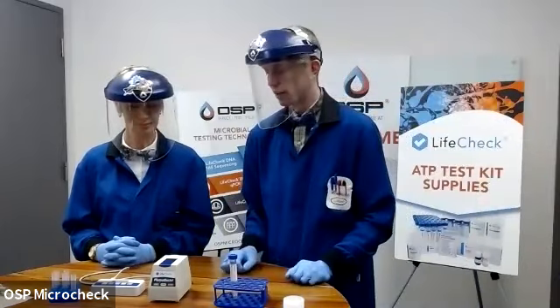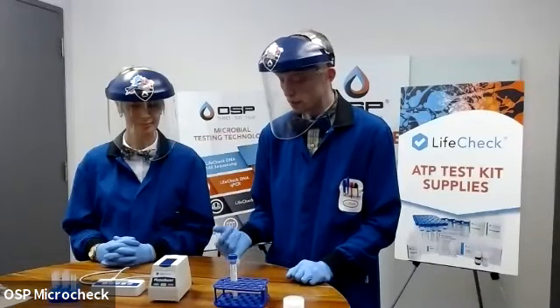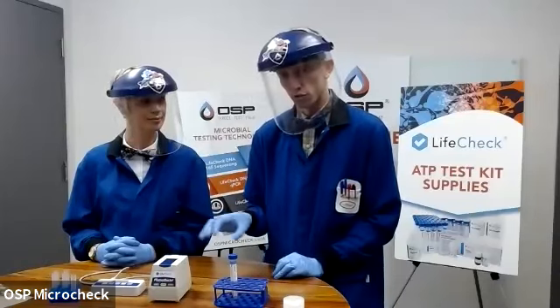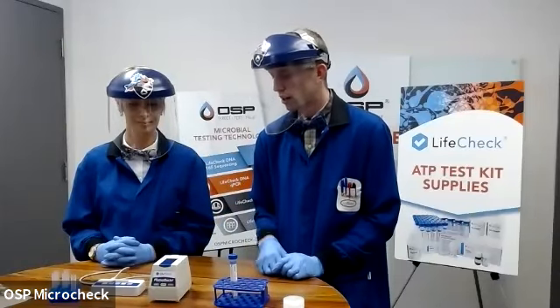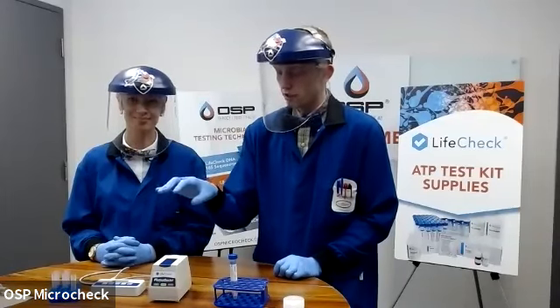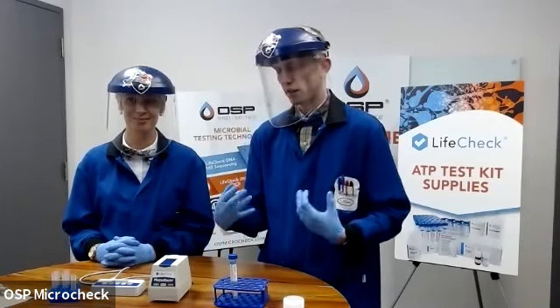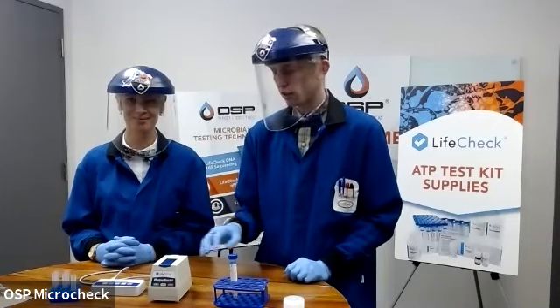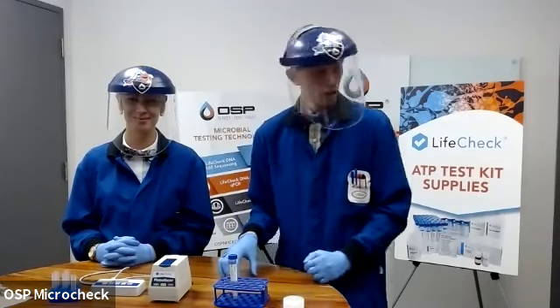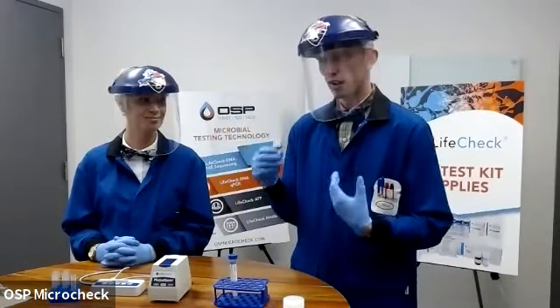To take that measurement and to do so in a way that has high repeatability and assurances that you've got quality data, we have to run a couple controls in our luminometer before we get started. So we're going to run two controls. One is going to be a blank, ensuring that the instrument itself isn't contaminated, doesn't have a high level of background reading that would hurt our lower levels of detection. And then we're also going to be running a positive control to indicate to us that our enzyme, which again is a living component, is healthy and happy.